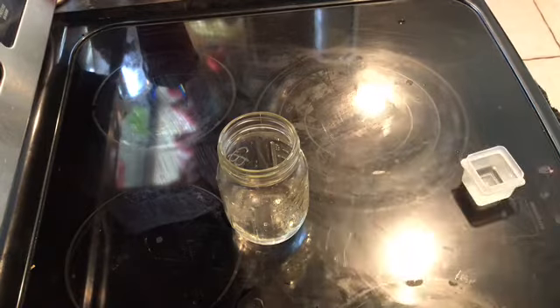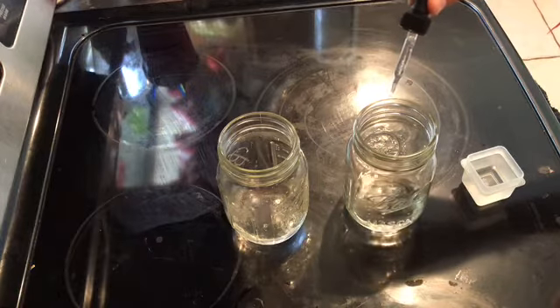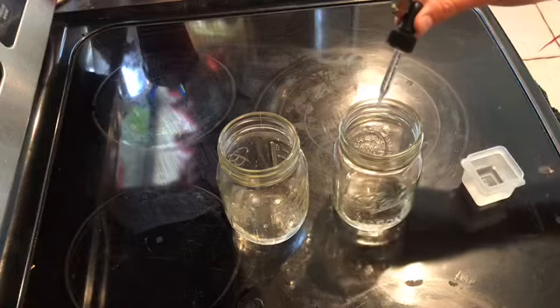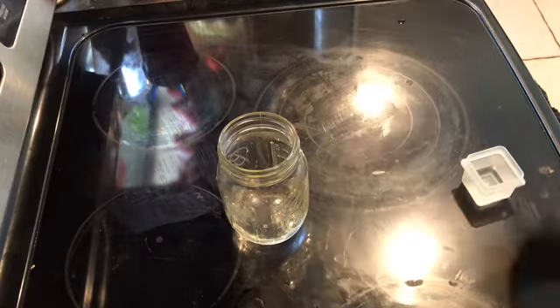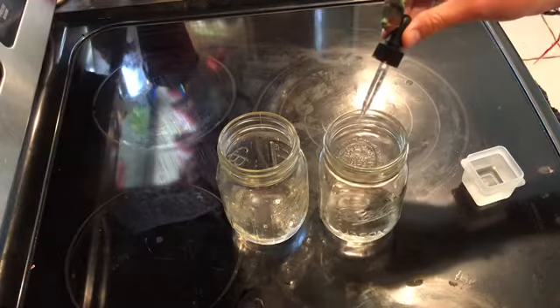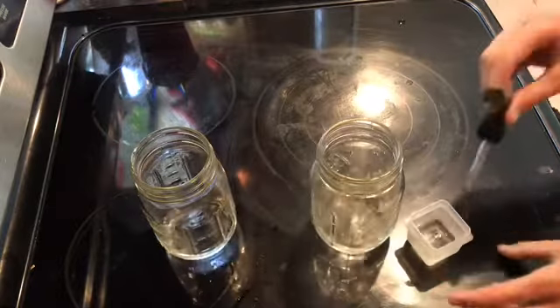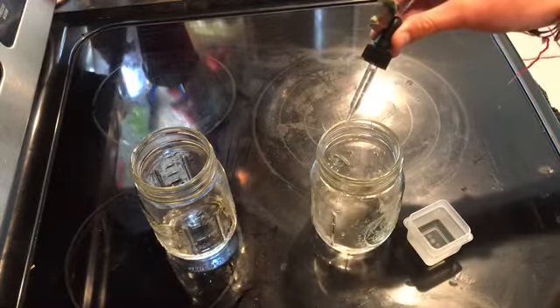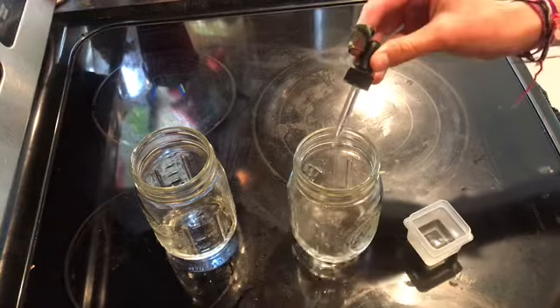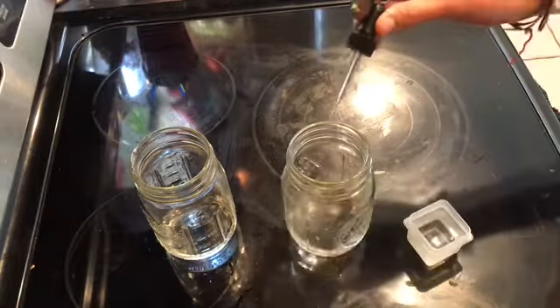In the first beaker, we added 40 drops of 1 molar HCl in 10 drop increments, making sure that we recorded the pH after each 10 drops taken. And then to the second beaker, we added 40 drops of 1 molar NaOH as well in 10 drop increments, making sure to measure the pH after every 10 drops.